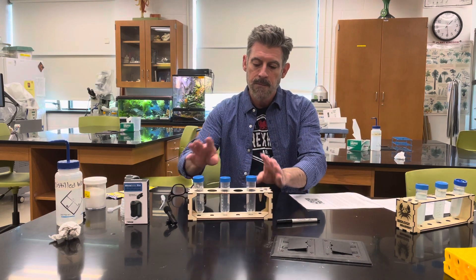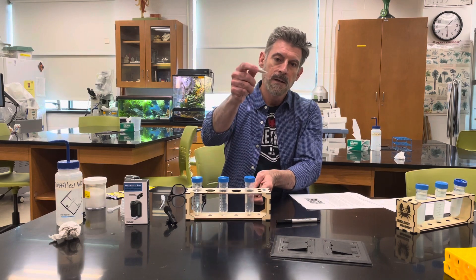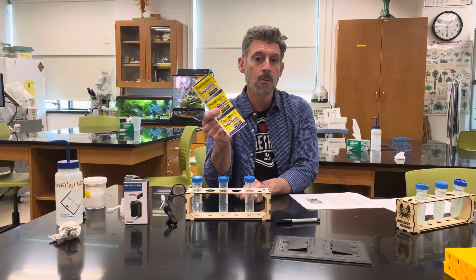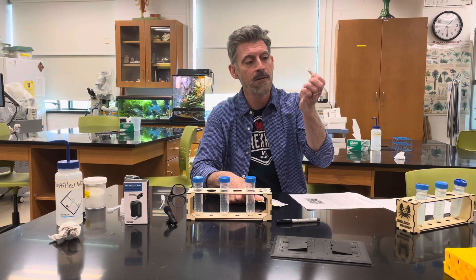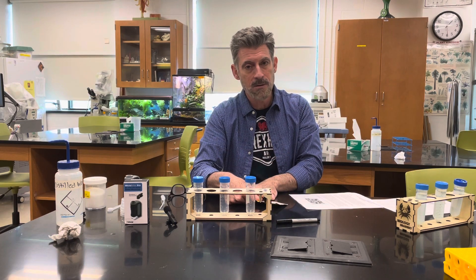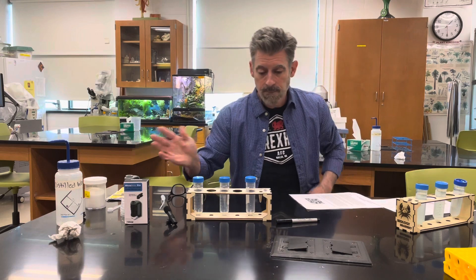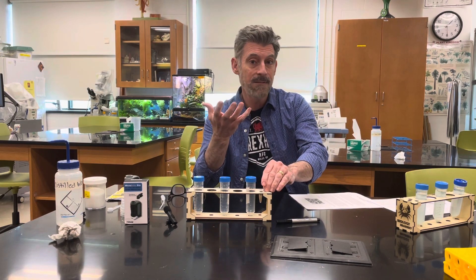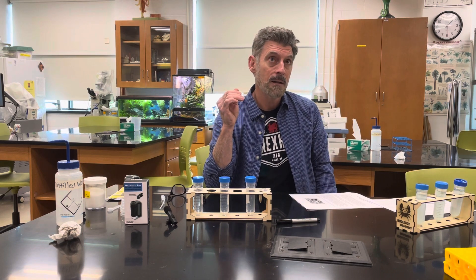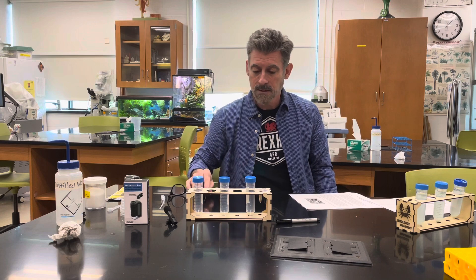You're going to need your test tube rack and three graduated centrifuge tubes with volumes marked on them. You'll need the yeast provided — it's the same as baker's yeast you'd buy in the store. If you're in the non-majors course you'll need to purchase more yeast, since you'll also be doing yeast fermentation experiments. The yeast is an edible, harmless organism that will become live cells we can observe. You'll also need methylene blue dye for vital staining — dead cells will take up the dye and live cells will not be stained.